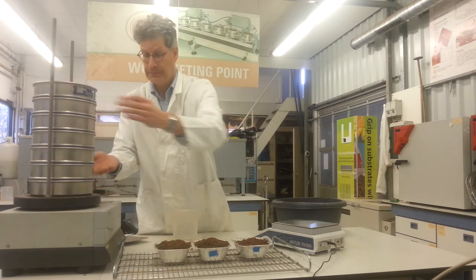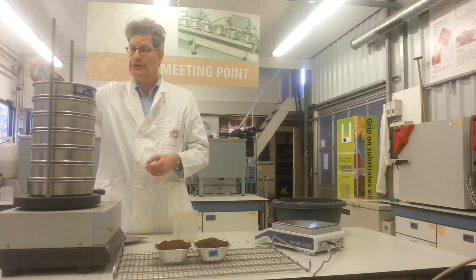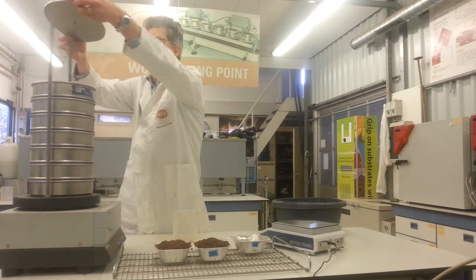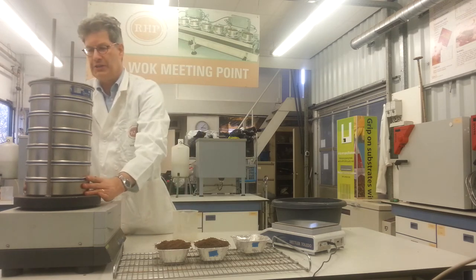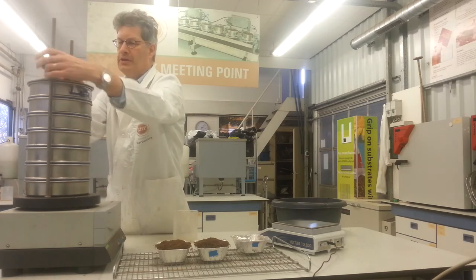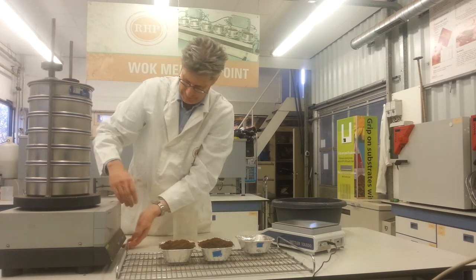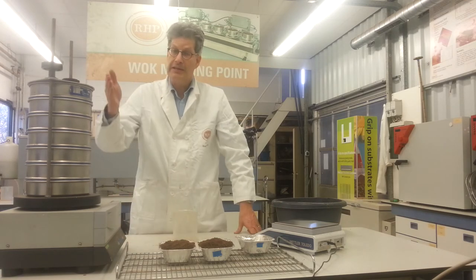Put them on the sieve shaker. And we bring in the material on the top — gently on the top. Close the lid. This particular system — you can find various systems of course — this is the one we use. Get the starter off.